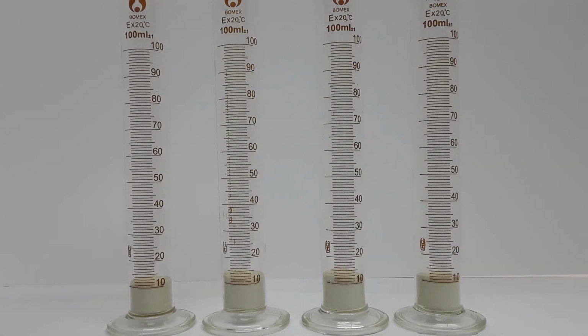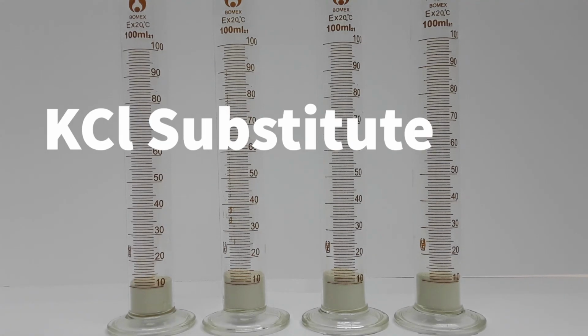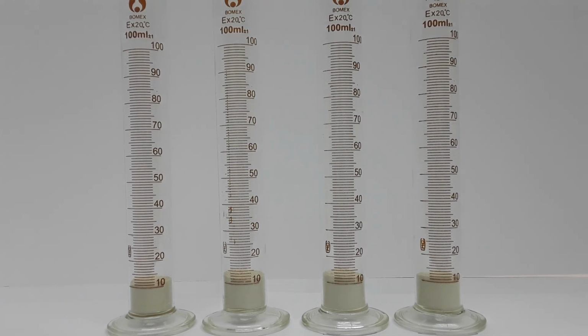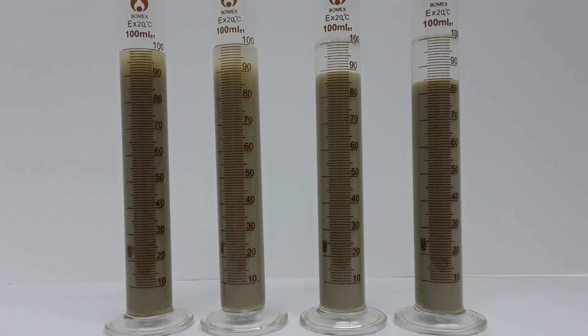We will then add roughly 100 milliliters of fresh water, seawater treated with a potassium chloride substitute, untreated seawater, and lastly seawater treated with PIC safe seawater product. Upon addition of the fluids, we will agitate the clay so that it is fully suspended within the liquid. We see now the clay suspended in the fluids, with some settling already occurring in some of the graduated cylinders.